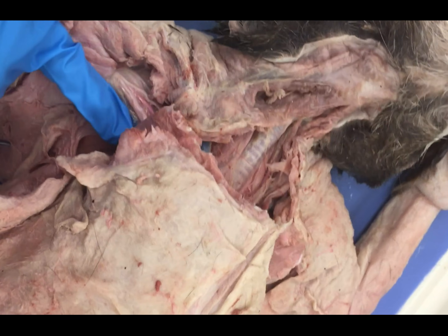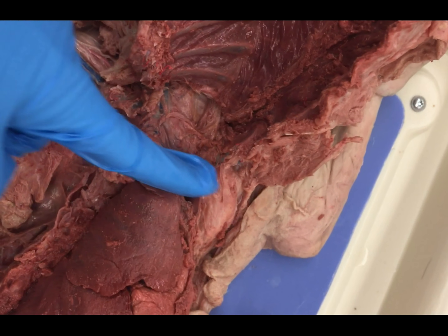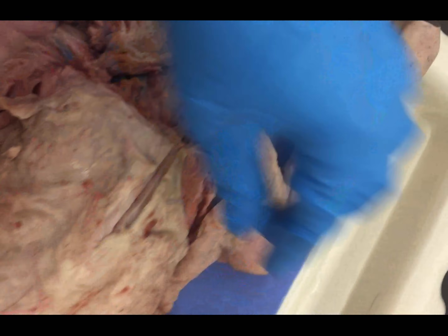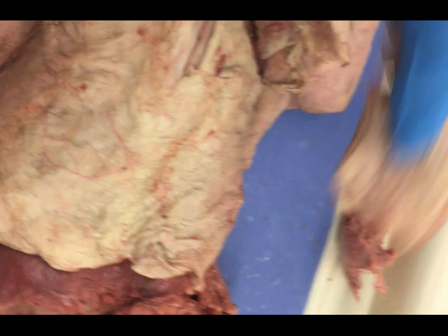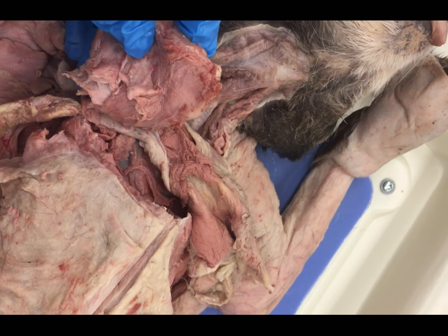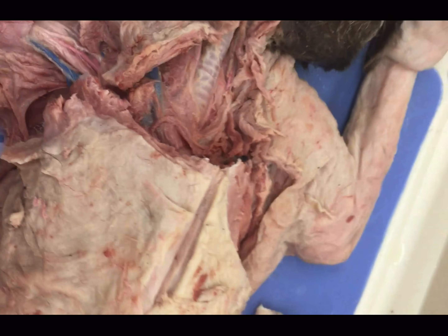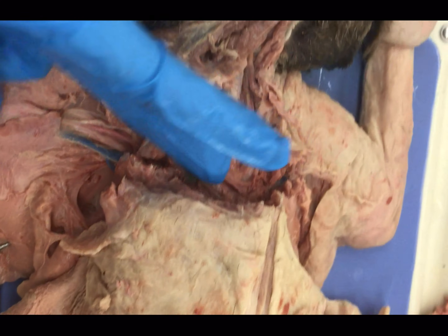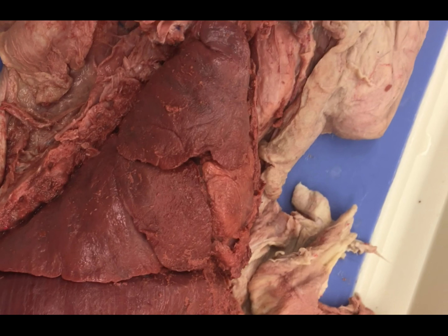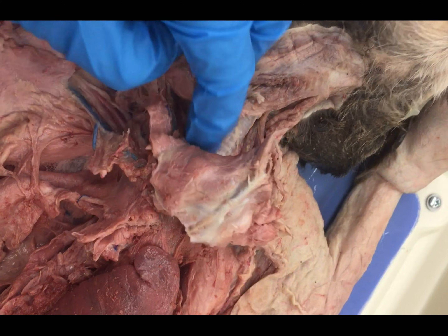Alright, so once you get up here, you have cut and reflected back the rib cage. The next thing you're going to want to do is cut across transversely. Mine's been completely dissected so it's going to look a little different. One of the first things you are probably going to want to do — and I'm just going to kind of lay these guys back over — is on the interior chest wall of the cat they have very large pectoralis muscles. So what you may want to do is simply cut them off, being mindful of these vessels down here. Once you've done that, you can use your bone cutters to cut to the sternum and then just give one big clip here, and this guy will come completely off. What you'll be left with is about that much of the rib cage left. There's going to be some thicker muscle here.